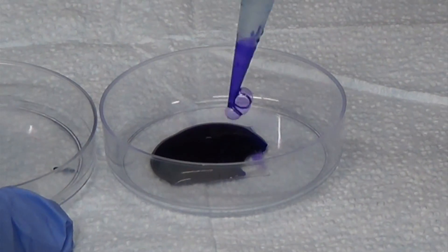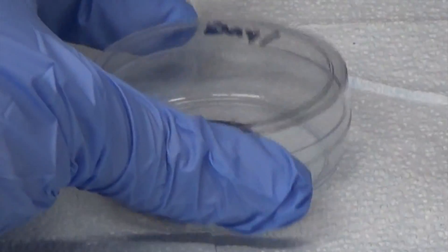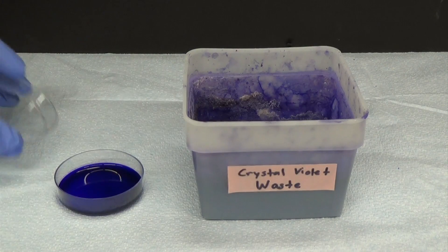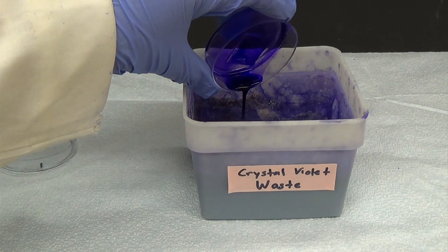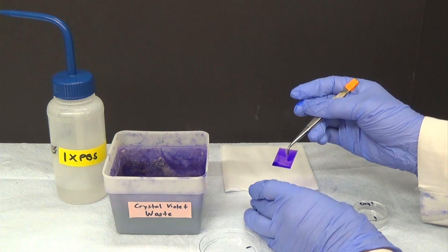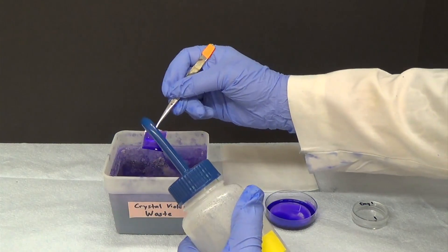Add 2ml of crystal violet solution to each dish and incubate the cover slip in crystal violet for 15 minutes. Crystal violet should not be disposed of in a sink. Instead, pour used crystal violet into a designated waste container. Remove the cover slip with forceps and wash with 1x PBS just as before; however, this time the runoff should be draining into your crystal violet waste container.